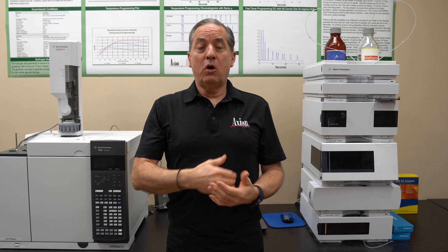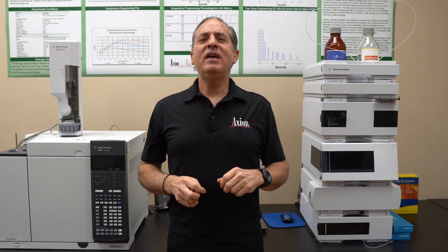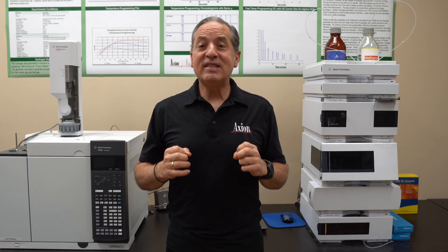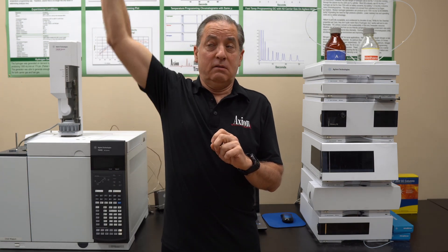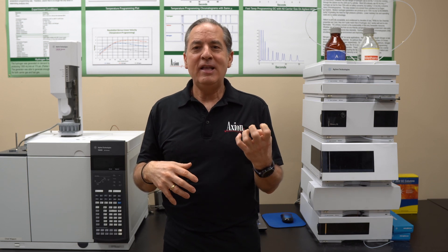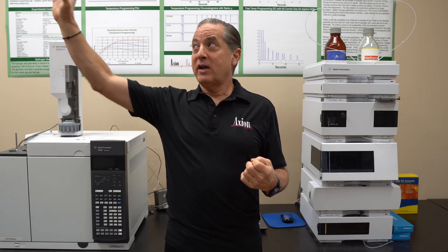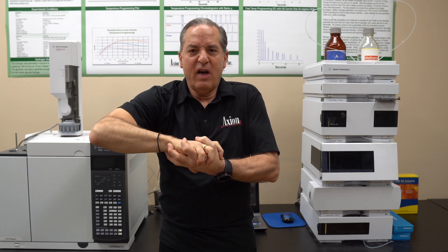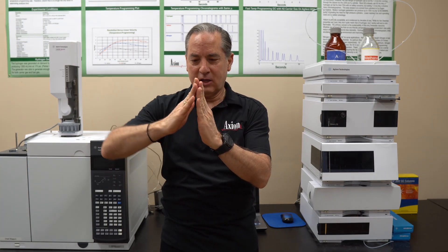Physical problems are due to the instrument. The chemical problem is what I call acid-base interaction. A typical HPLC stationary phase is based on silica. The surface itself is slightly acidic — the SiOH is acidic, polar, and weakly acidic, meaning the hydrogen can dissociate, leaving behind a negative site. So your column has a natural negative charge to it. If you have an amine — a basic compound — when it's ionized, it has a positive charge. That positive charge moving through the column gets adsorbed by the negative charge on the column. I call this velcro, because adsorption is easy to stick but hard to let go, and that's why you get the tail.